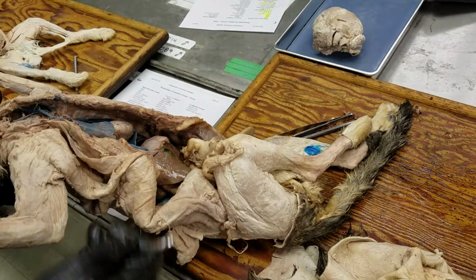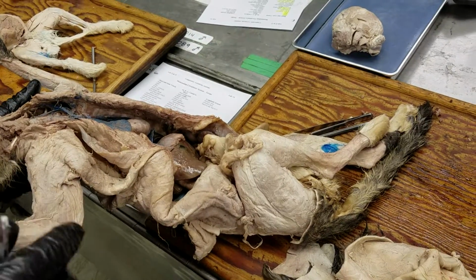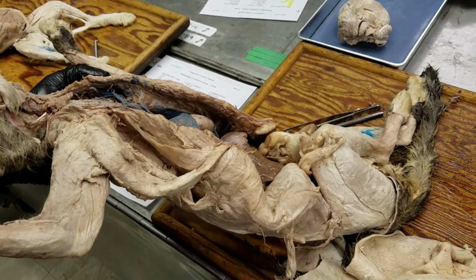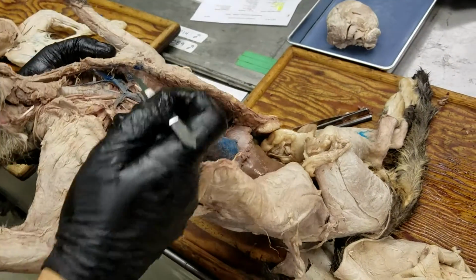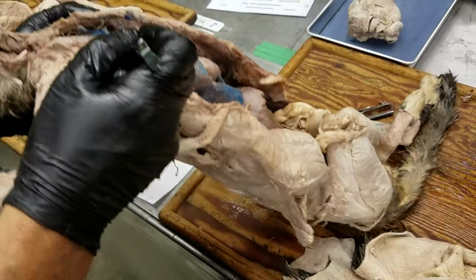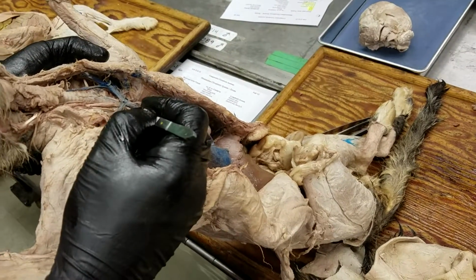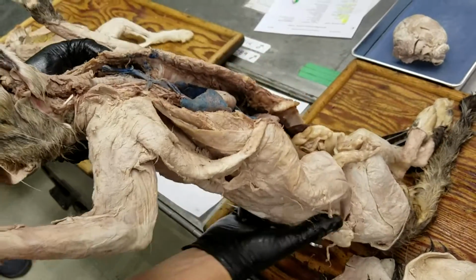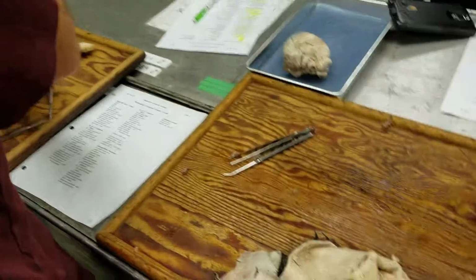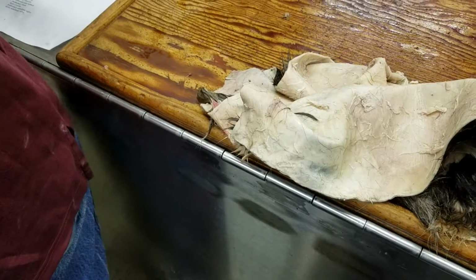What I didn't point out about the cat has to do with the veins. I said, oh, it's only got one cranial vena cava. Going back to the diagram I drew, what we're looking at here is the cranial vena cava of the cat. And then just in front of that, what we see are two vessels, and these are called the brachiocephalic veins. Okay? So this is not present in the rabbit. Here's the cranial vena cava, and then here's the left and right brachiocephalic vein of the cat. Left and right brachiocephalic vein.